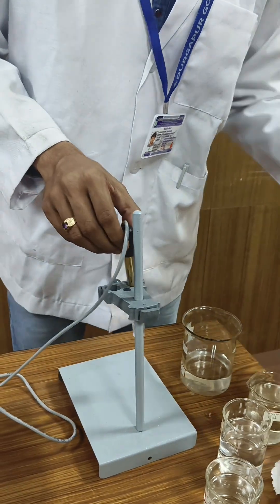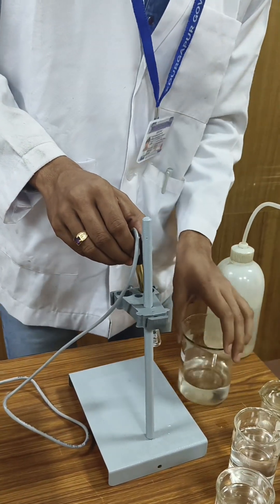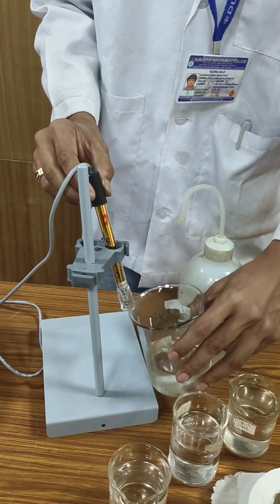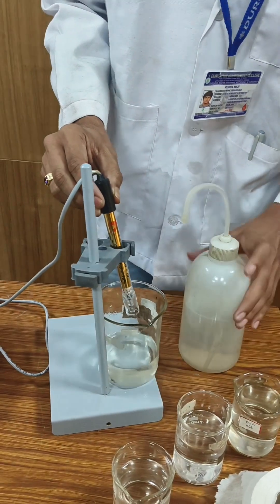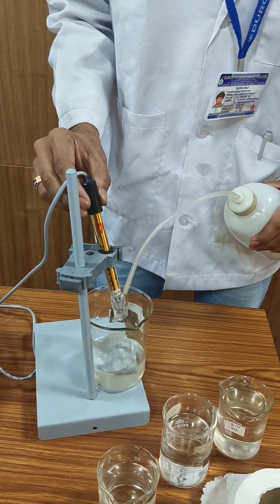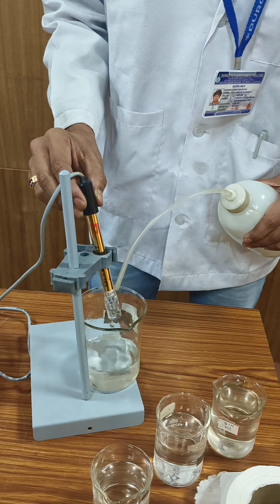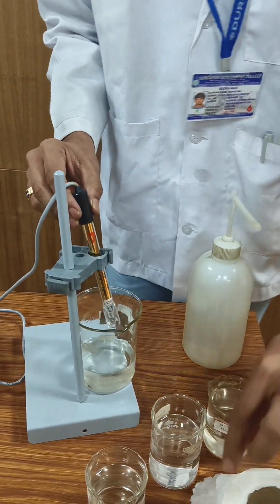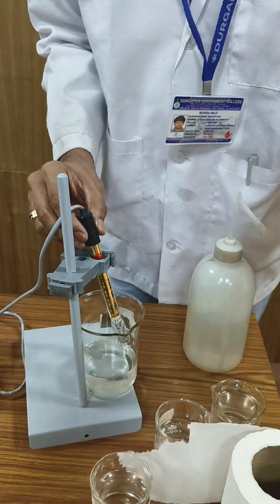Wash the electrode properly and clean it.